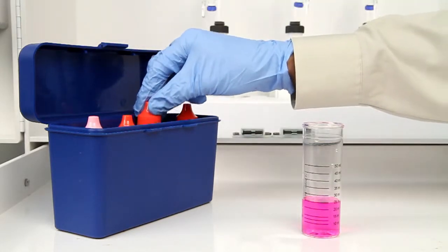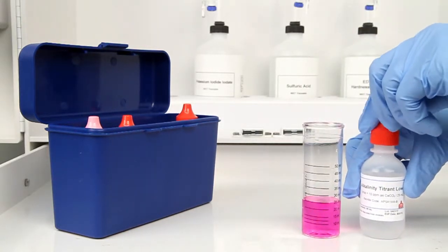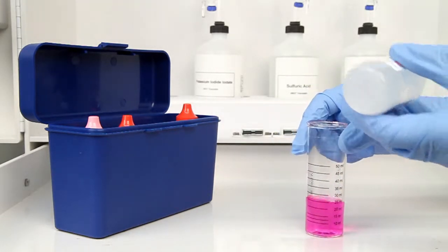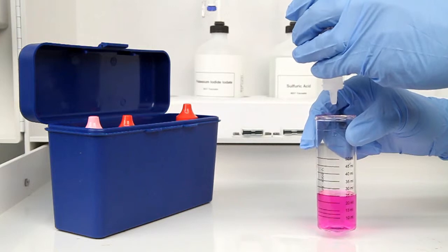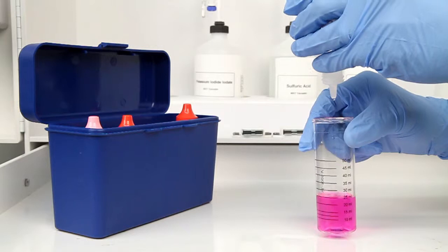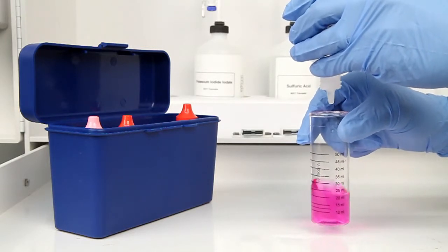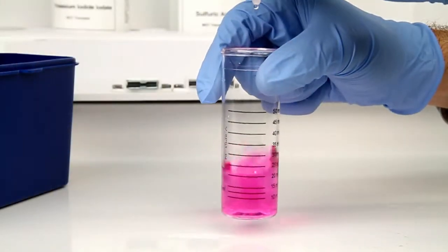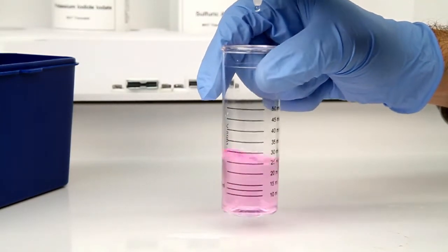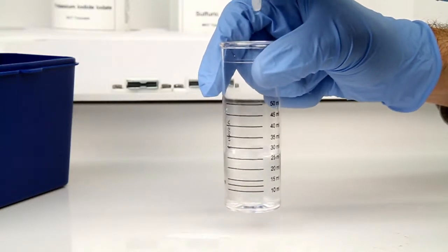The next step according to the Endpoint ID procedure is to perform the titration. Each bottle of titrant is labeled with the equivalency and sample size it was manufactured for. It's important to make sure you have the proper titrant and the proper sample size for this titration. The bottle of titrant contains a dropper tip, therefore it's important to hold the bottle vertically to make sure you get a consistent drop size. After the addition of each drop of titrant, swirl the vial to make sure the sample is properly mixed. The titration is complete when the sample changes from pink to colorless.